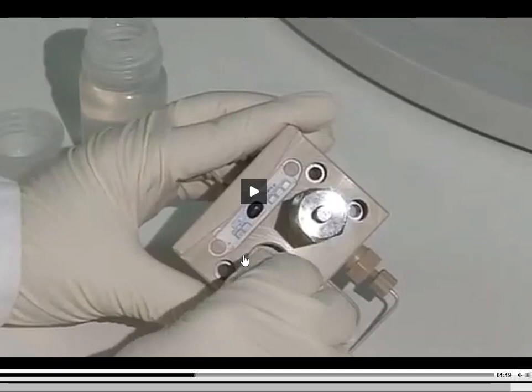Sometimes you can clean them, and sometimes a good healthy rinse with isopropyl alcohol or methanol will do the job, but sometimes they're going to have to be replaced. All right, so that's what you're seeing here. It's the replacement of those little O-rings is normally what I would call them, or seals, okay?